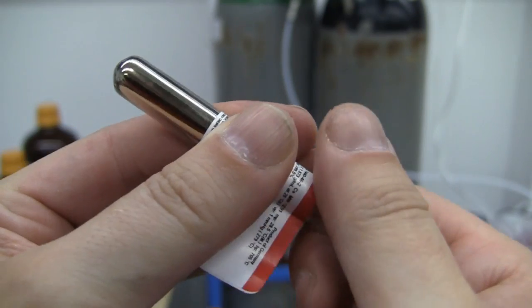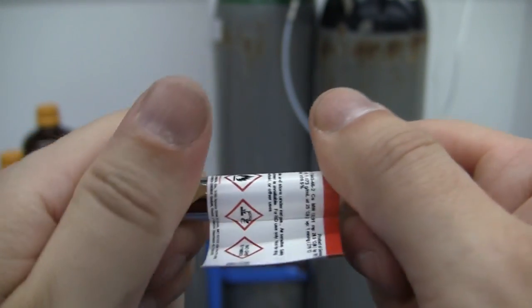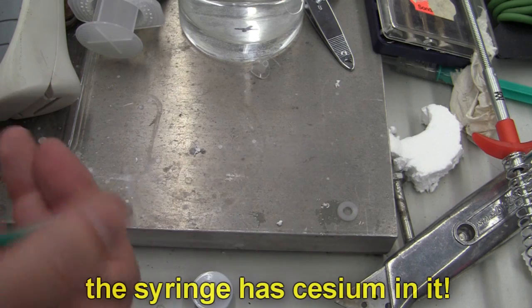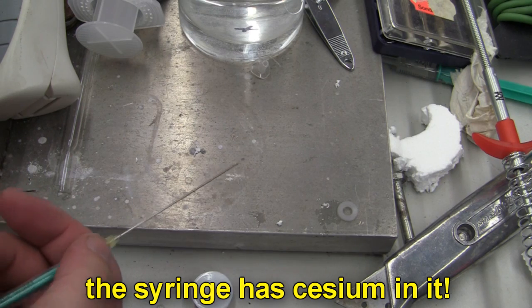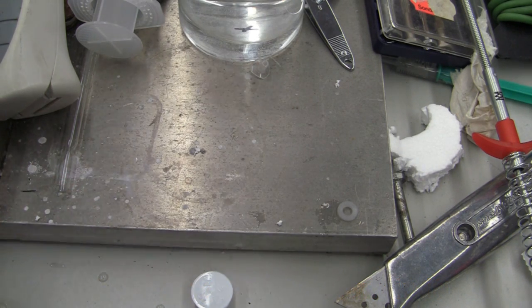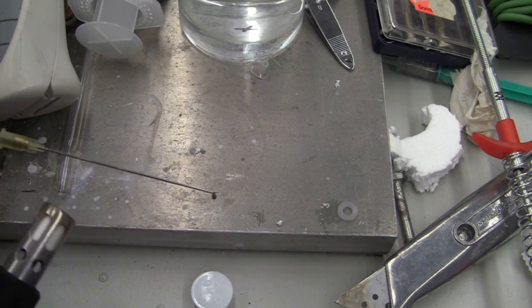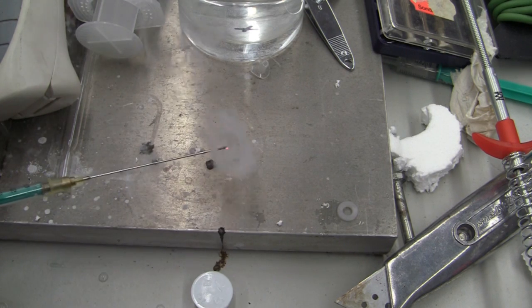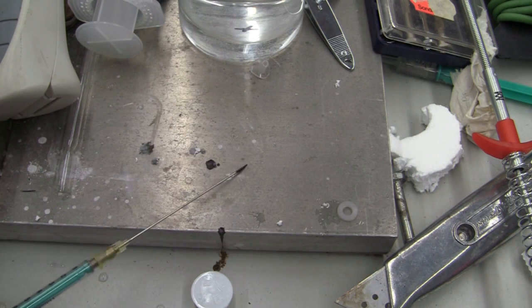They say it bursts into flames when in contact with air, which I don't believe. So I think I burnt the needle just very easily. Oh, there we go, there's cesium for you. It's a little warm.